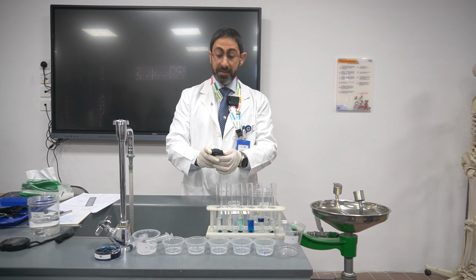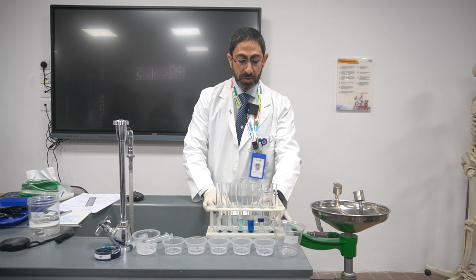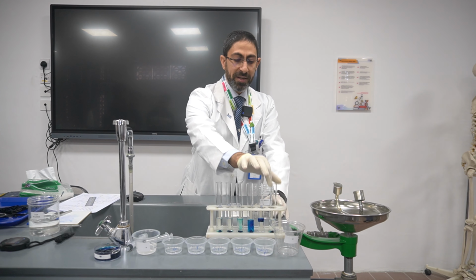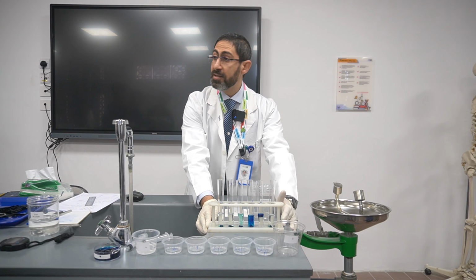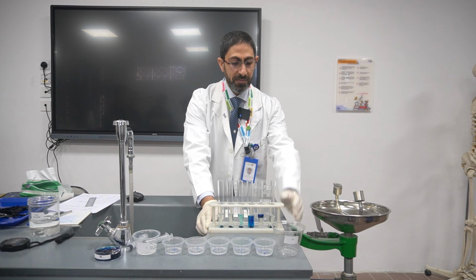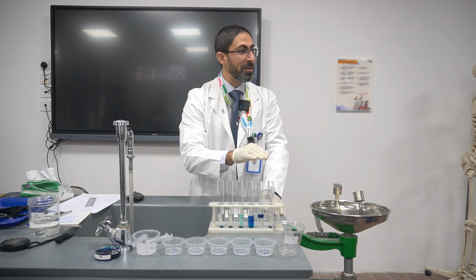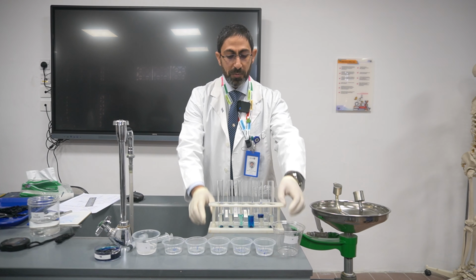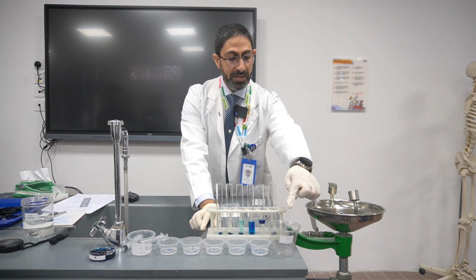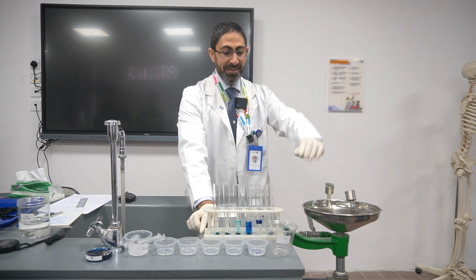Okay. Now 10 minutes have passed, we will take the recordings. First, we have the distilled water. The distilled water, its sodium chloride concentration is 0. Exactly, 0. I will arrange them from the lowest concentration to the highest concentration. So the first one is distilled water, the concentration of sodium chloride here is 0.